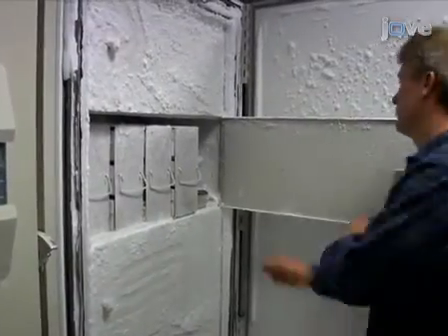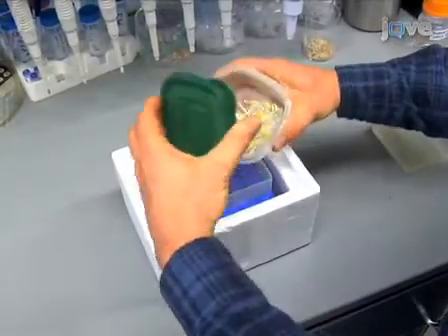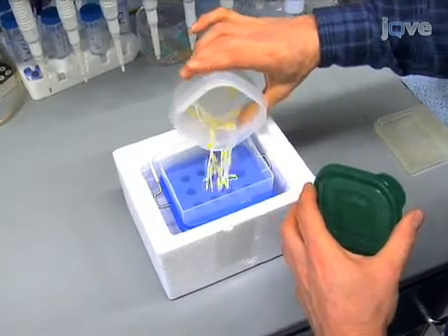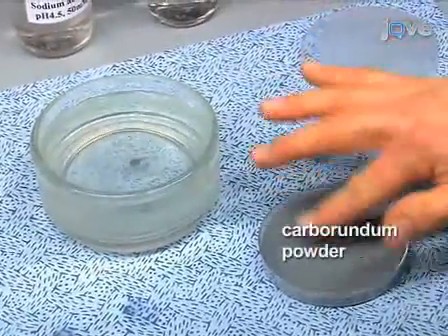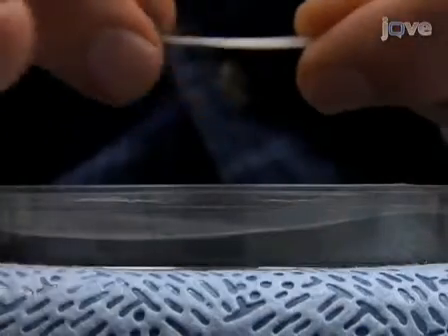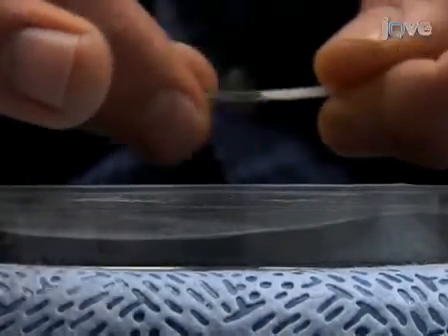To begin preparing cell wall samples, small groups of 8 to 10 frozen cut seedlings are transferred from the freezer to an insulated container containing a negative 80 degrees Celsius freezer block. Using a thick slurry of carborundum powder to coat the thumb and forefinger, the cuticle covering of the hypocotyl is removed by repeatedly drawing the hypocotyl between the thumb and forefinger.